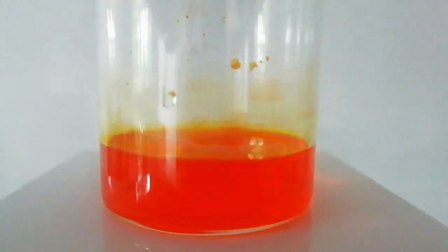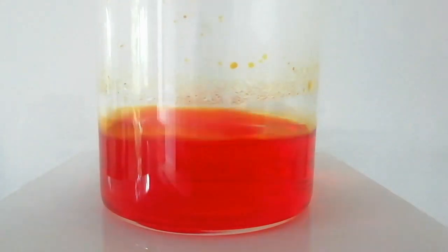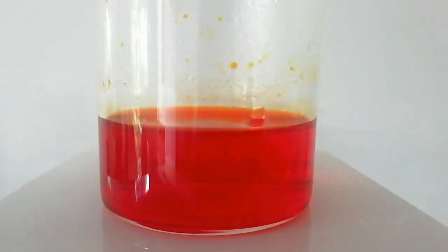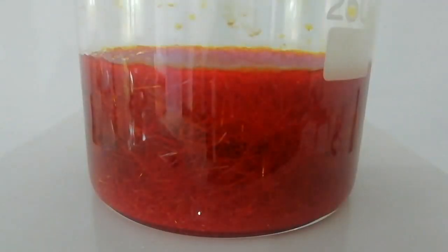Then 50 milliliters of 98% concentrated sulfuric acid was added to the mixture slowly. Addition of sulfuric acid is highly exothermic. It gives out a lot of heat.